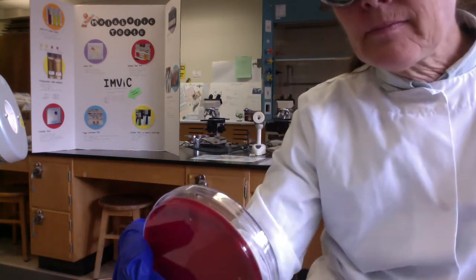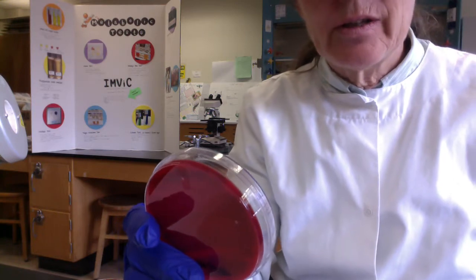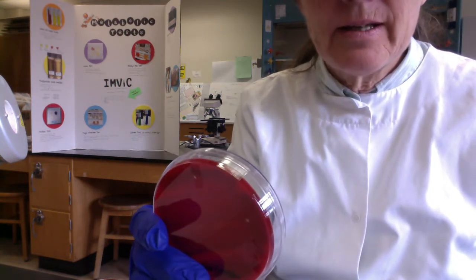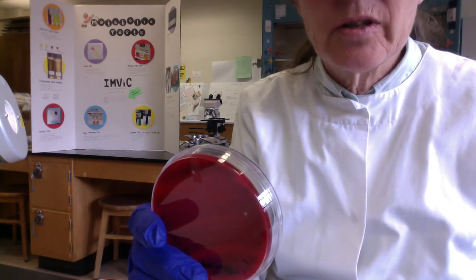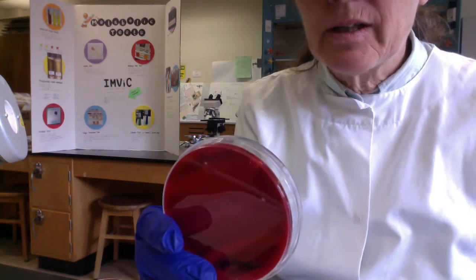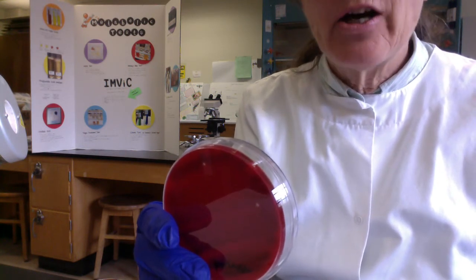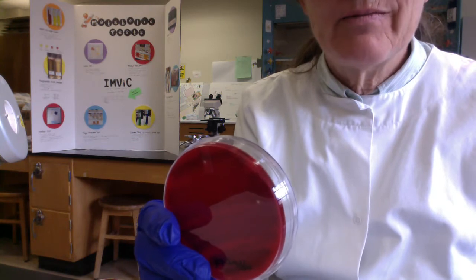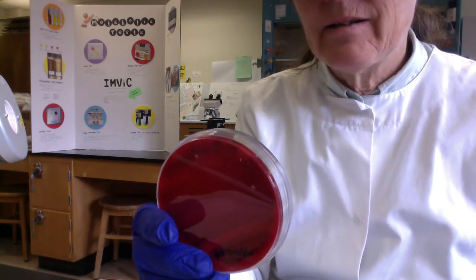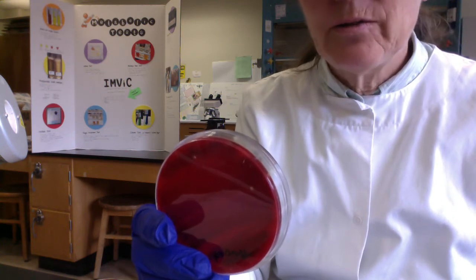And then because Streptococcus pyogenes can trigger this attraction and then killing of the white blood cells as they make toxins called leukocidins, literally white blood cell killers. Because Streptococcus pyogenes is great at making pus. Pyogenes, pyo means pus, and genes means to make. So these are pus-making bacteria. So we call them pyogenic bacteria because they're making the leukocidin.